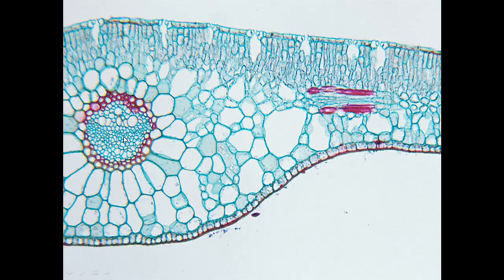Xylem would be these big ones, phloem the smaller ones. This bit here, you might be wondering what's going on over there. That's actually just a vein that's going sideways. So it's one of these that's been chopped, essentially looking at it sideways. So in here we would have maybe our xylem at the top and the phloem at the bottom, if it's arranged like it is here. It's just a lateral vein, one that's running sideways rather than going towards or away from us. Okay, so I think there's more than enough things we could identify there.